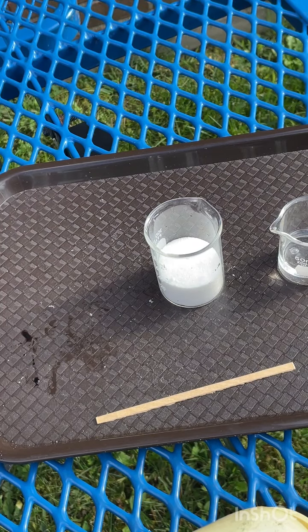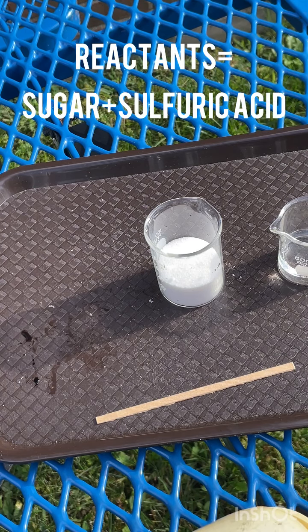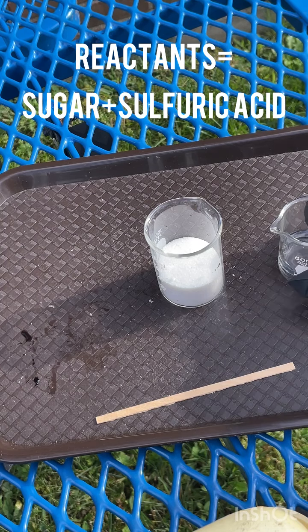We're looking for signs of a chemical reaction. So right off the bat, I want you to think about if I'm dehydrating something, it means that there must be something occurring with water. If we're starting with sugar, it's got carbon, hydrogen, and oxygen. We know the chemical formula for water is H2O, so we're essentially going to be pulling the hydrogen and oxygen out of the sugar and leaving behind the carbon. Since sulfuric acid also has sulfur in it, it's going to be producing a gas called sulfur dioxide. So during the demonstration, I'd like you to observe for signs of chemical change, chemical reaction.